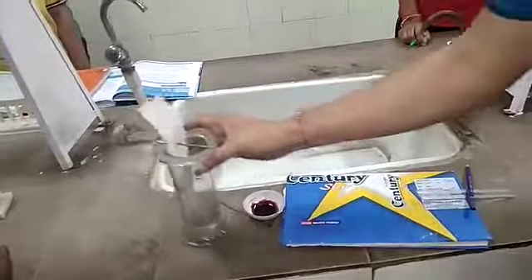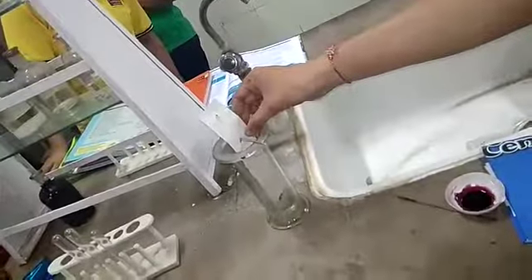And now, we will suspend this paper for half an hour. After half an hour, we will see what the results are.